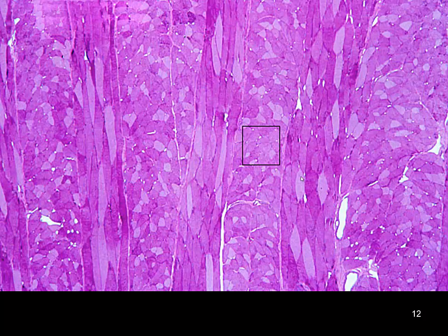But it gives you a great appreciation for how these fibers can be cut in such different planes of section to make it very challenging to identify, especially at a low mag like this. But if you look at the mottled color, you can see some darker and some lighter. This is really getting into our fiber types.